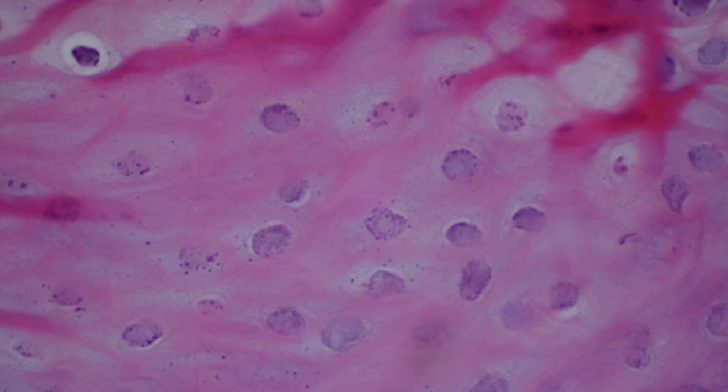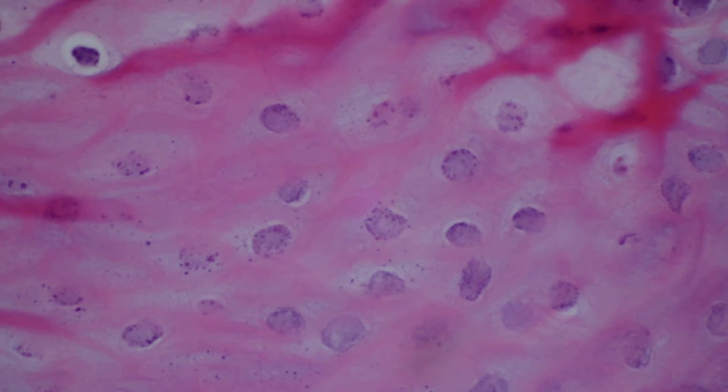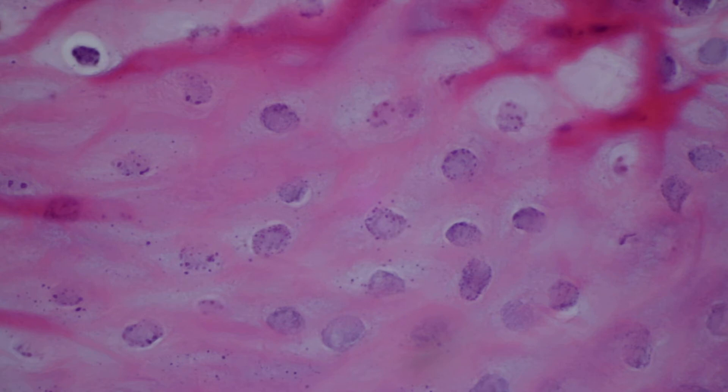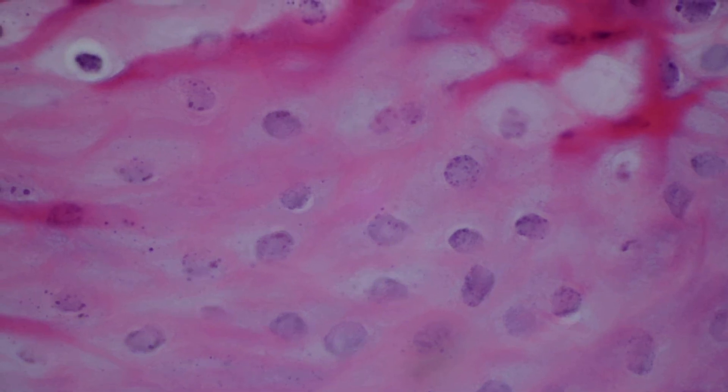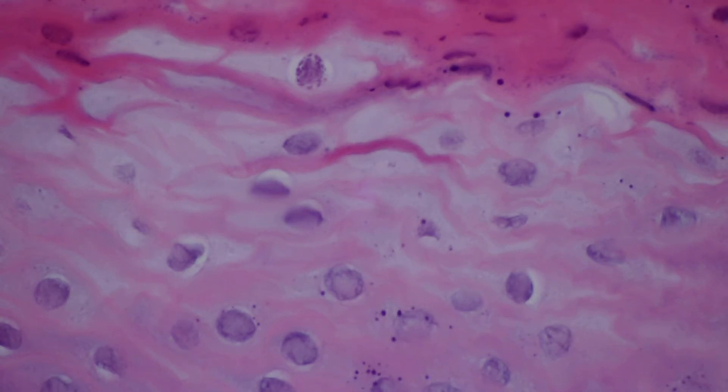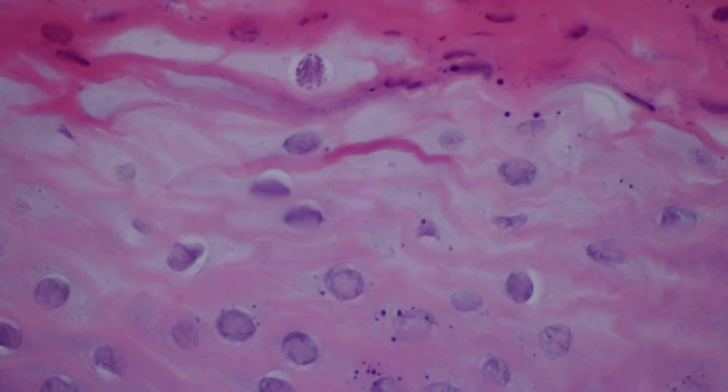A really nice example of that beaded condensed chromatin: as the chromatin gets pushed out to the periphery, it leaves a glassy, slightly eosinophilic area in the center of the nucleus. That's similar to what you see in other types of herpes virus infections — that's the Cowdry type A nuclear inclusion. You can kind of see it here, this glassy homogeneous pale eosinophilic central area in the nucleus.